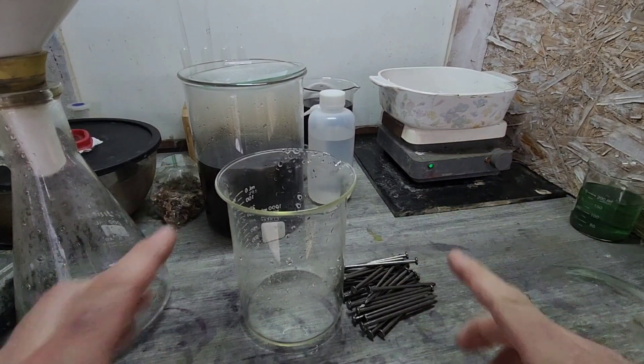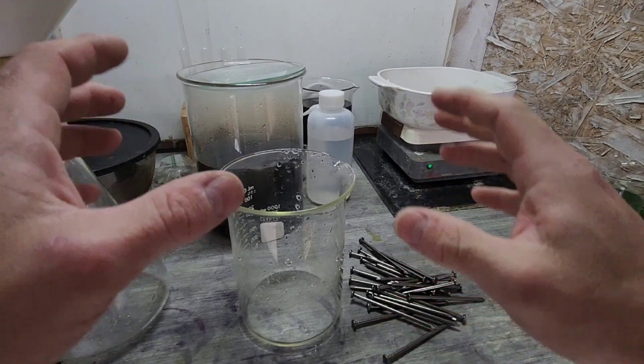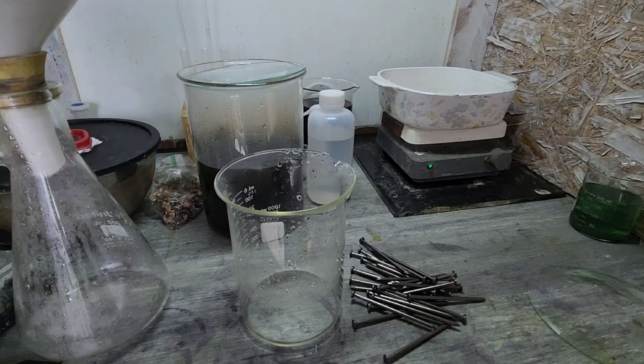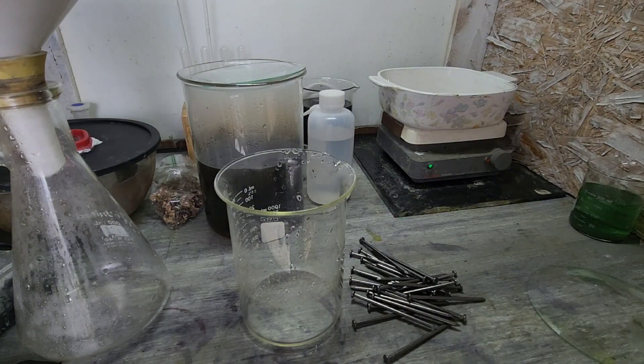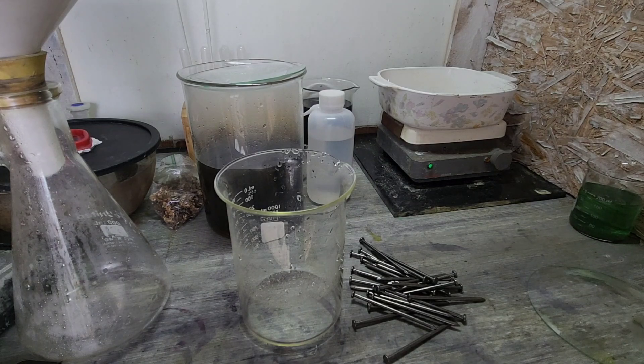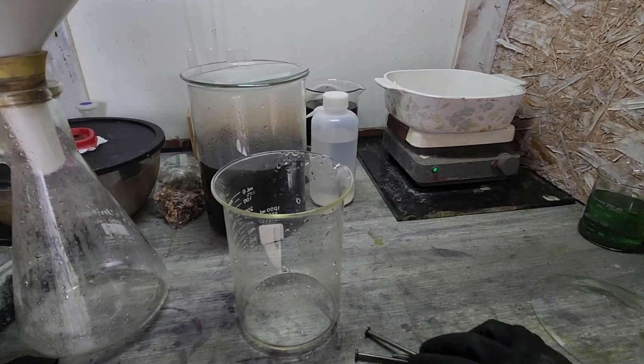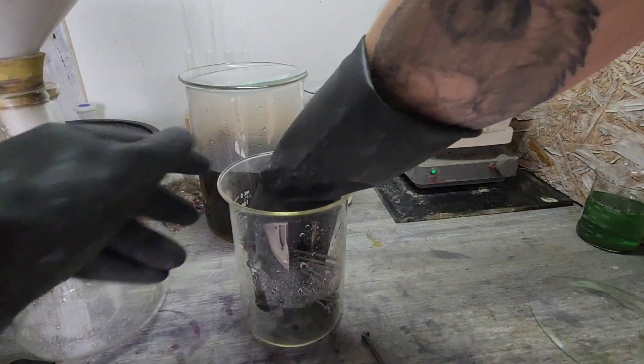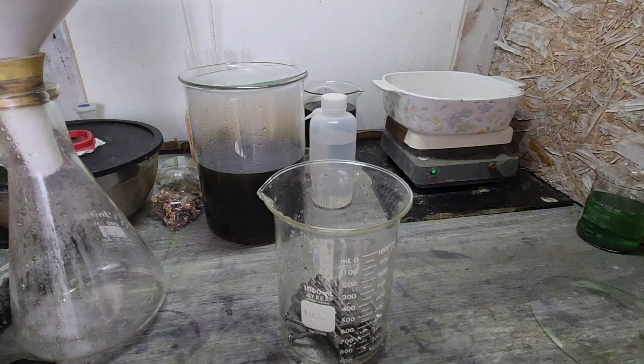I don't want to give anybody more money for ferrous sulfate, especially when I'm going to make my own much purer. I think it's going to be worthy of dropping the one ounce, so let's go ahead and start on that. Get gloved up here. All right, I got my finger in the wrong hole and I'm knocking the tripod over. Holy smokes. All right, so let's see here, nice and gentle with those.